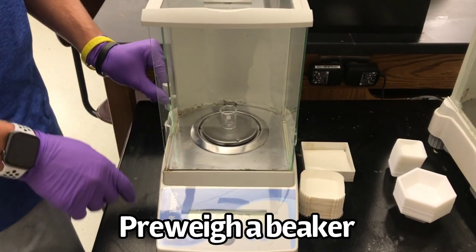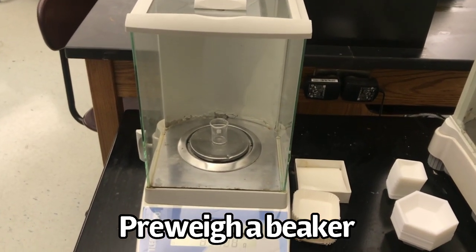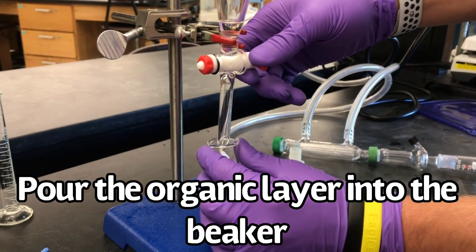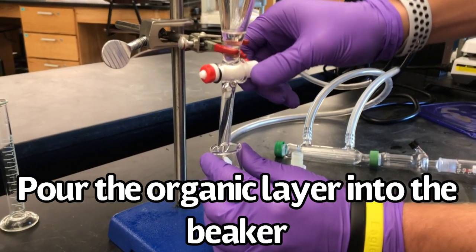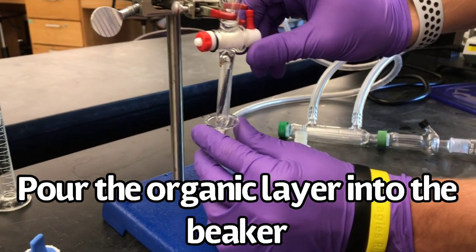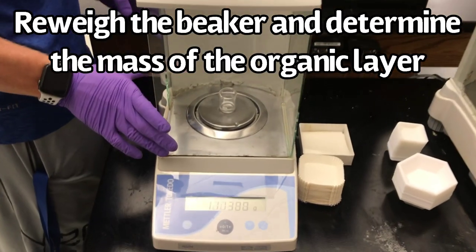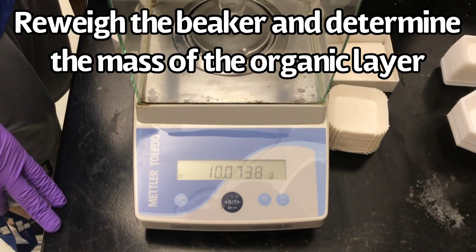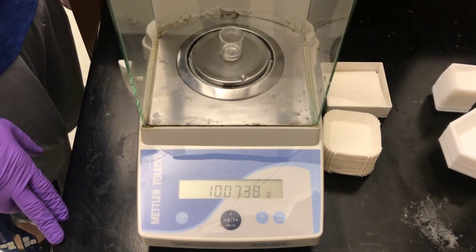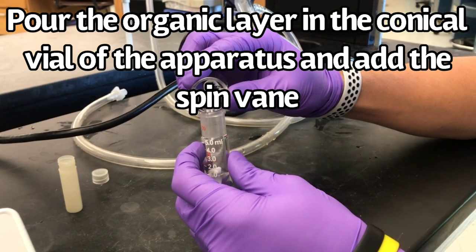Pre-weigh a beaker. Pour the organic layer into the pre-weighed beaker. Re-weigh the beaker and determine the mass of your organic layer. Pour the organic layer into the conical vial of your apparatus and add the spin vane.